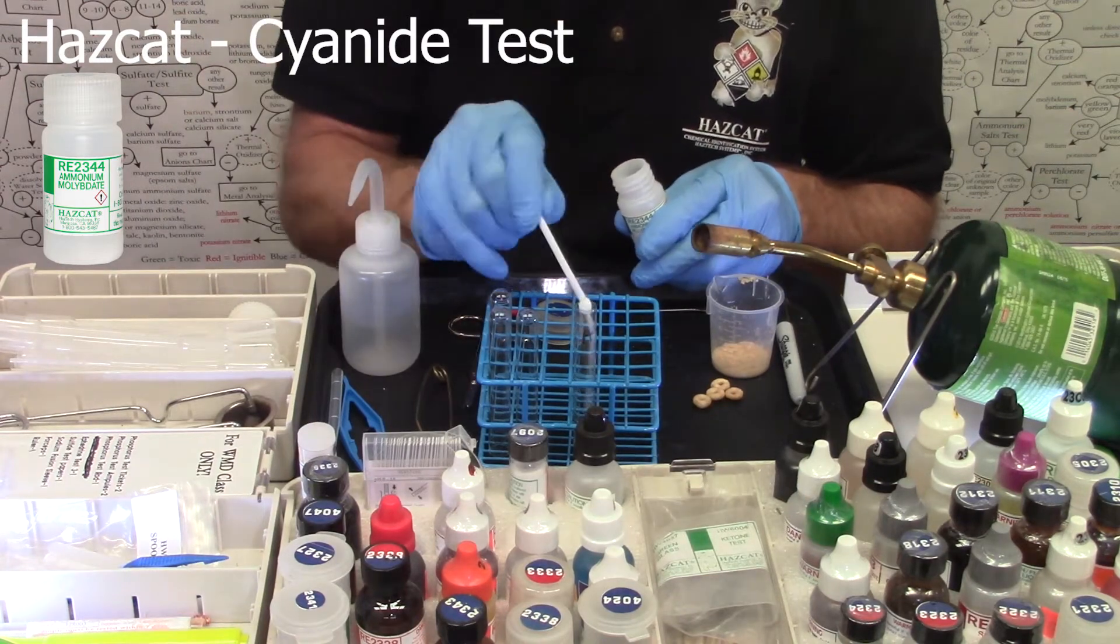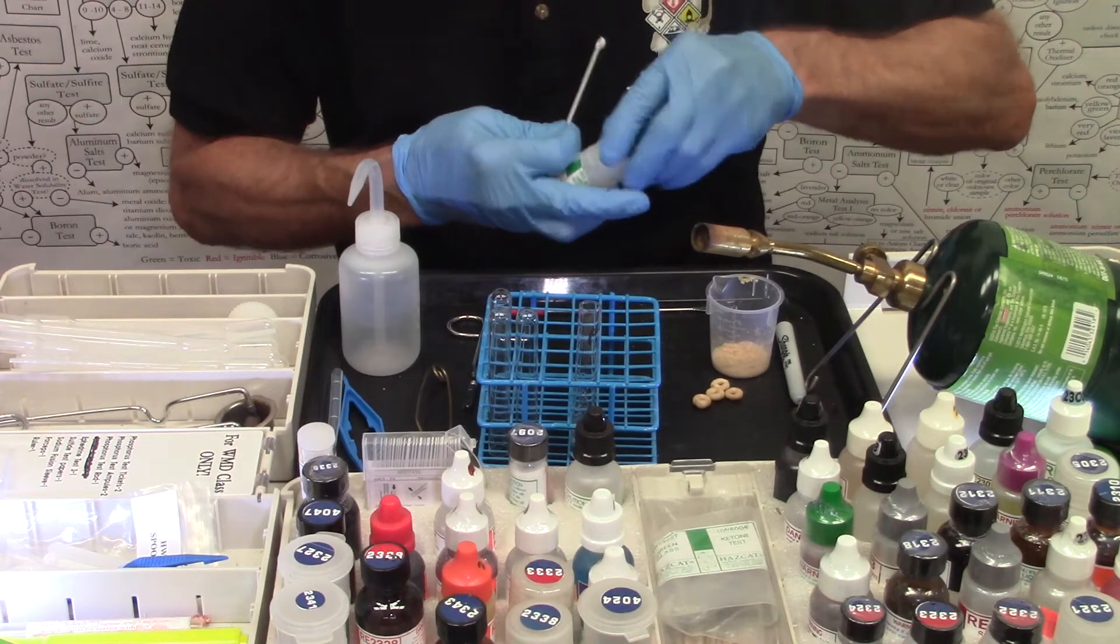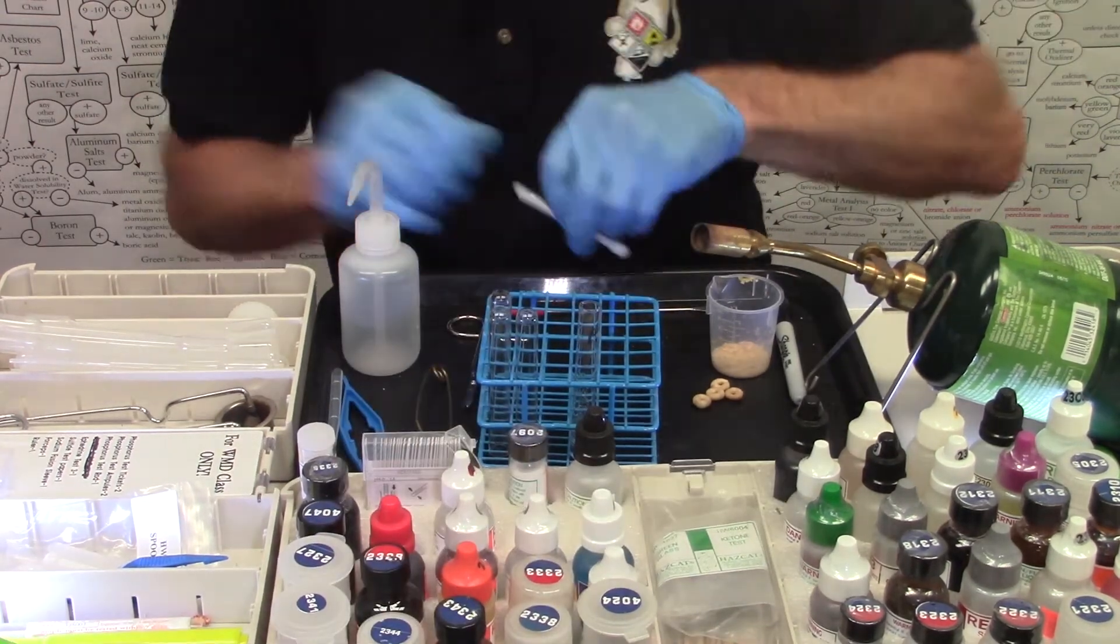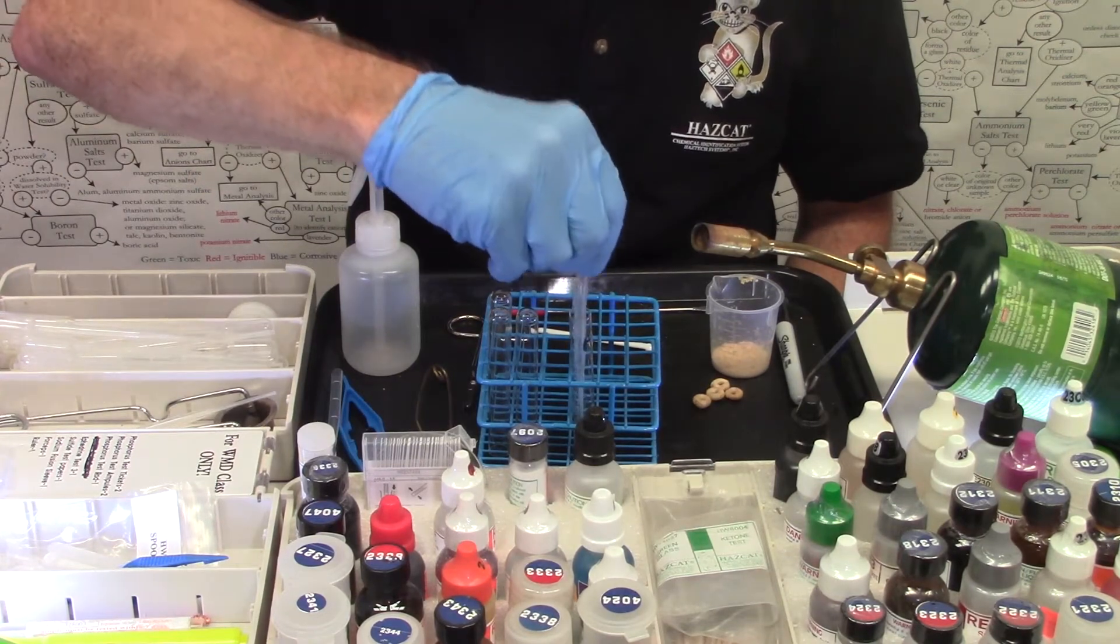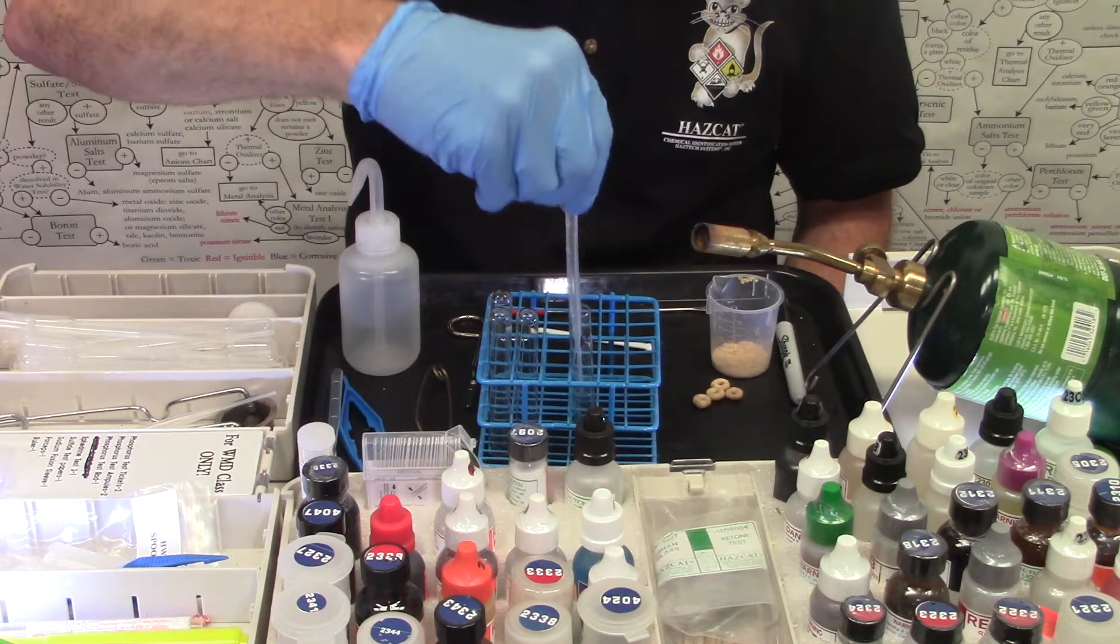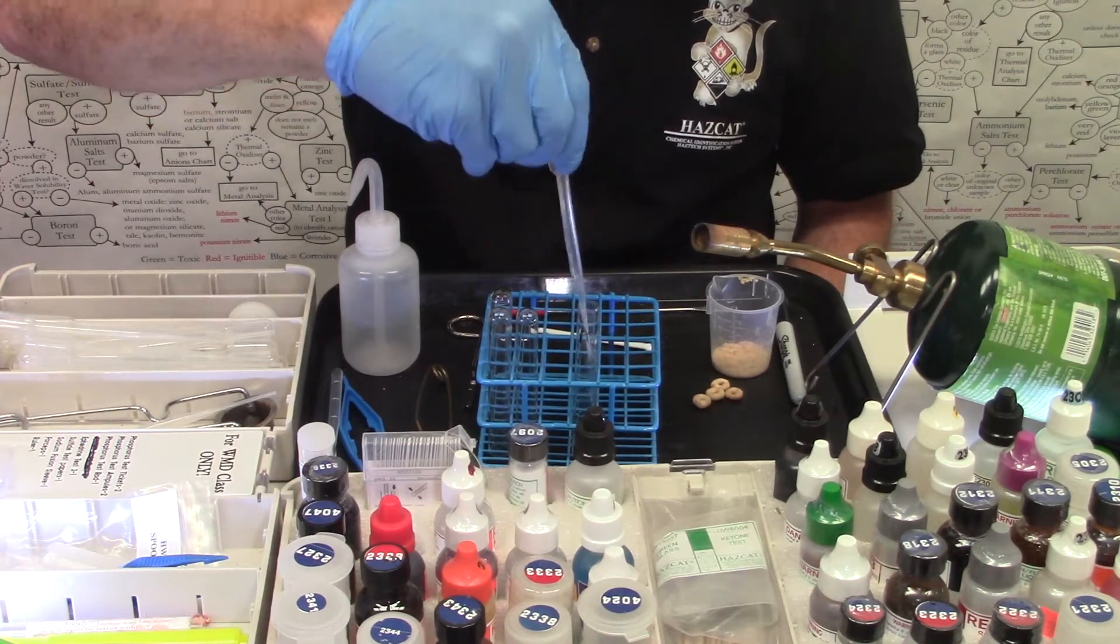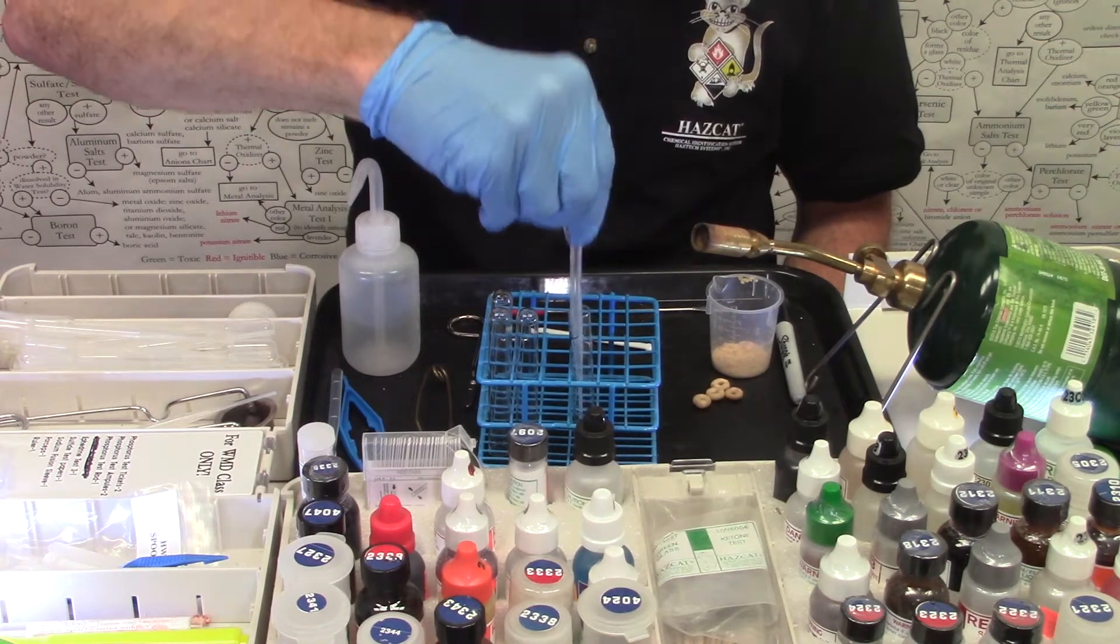Half a spoonful. We're going to go ahead and mix that with a pipette until it dissolves by sucking it up and spitting it out about ten times.